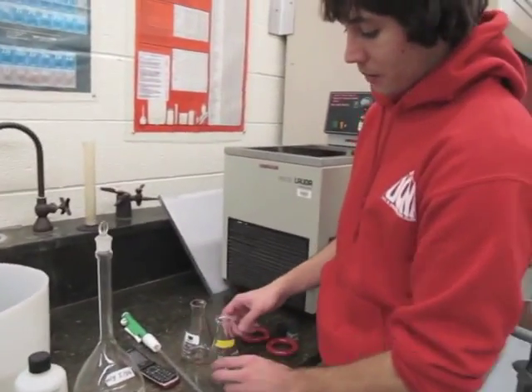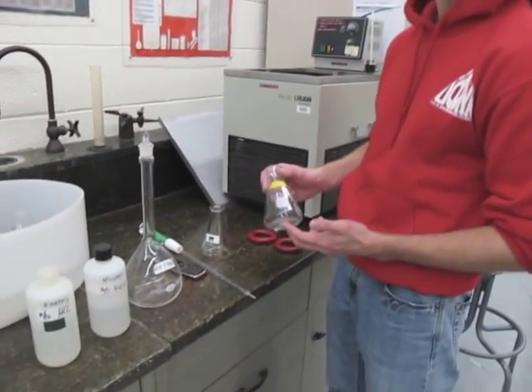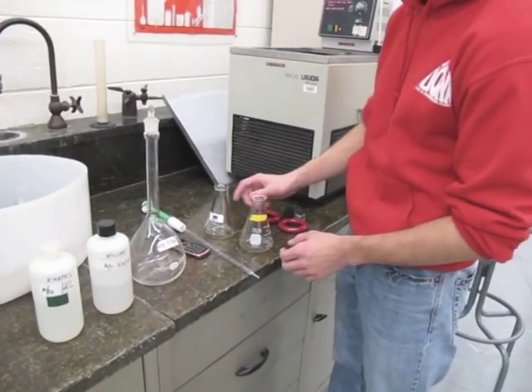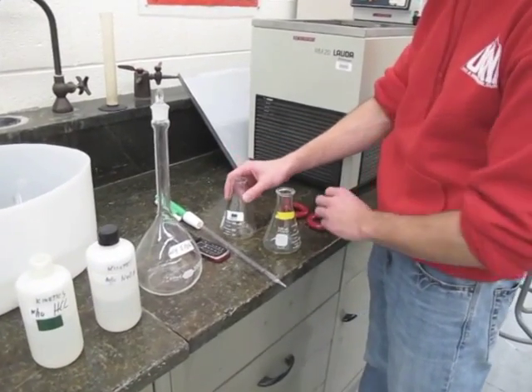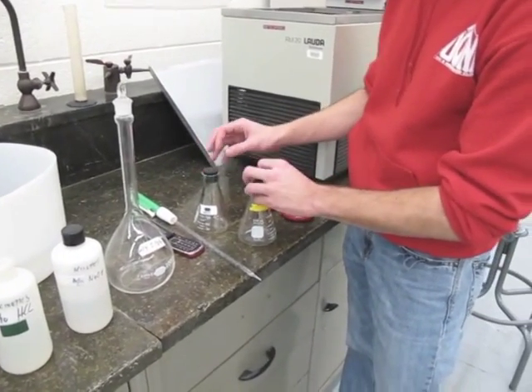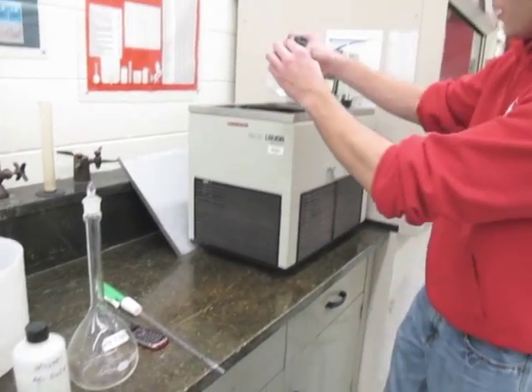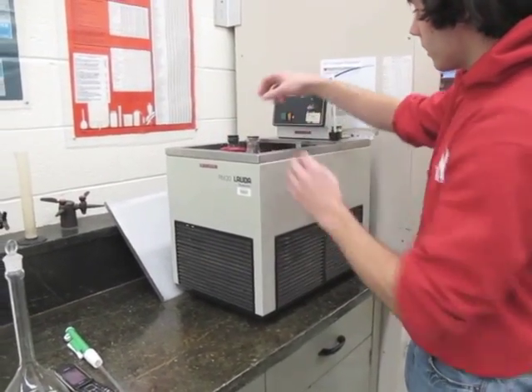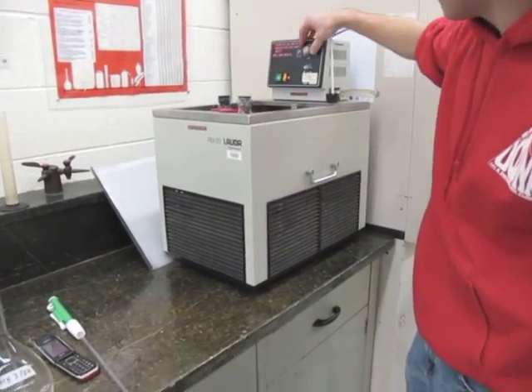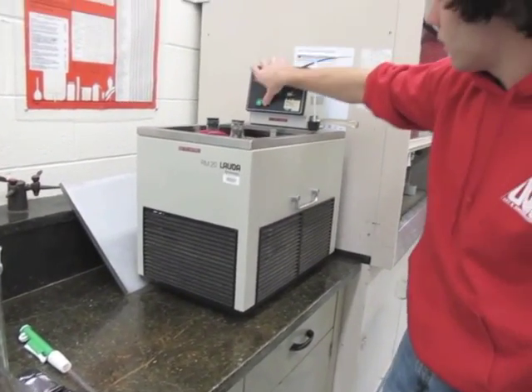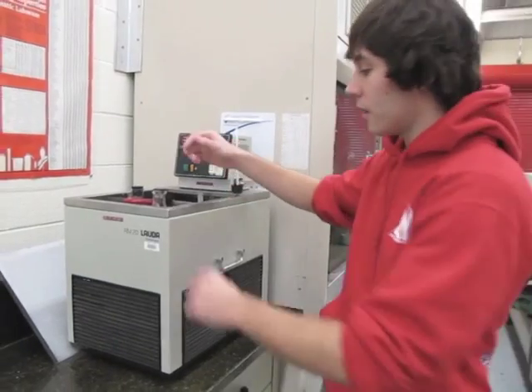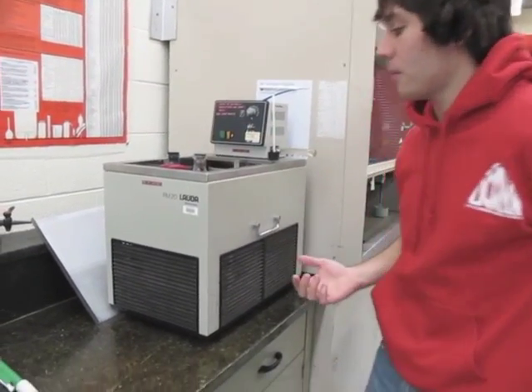To begin the experiment, you're going to add 100 milliliters of isopropyl acetate to this flask, 100 milliliters of sodium hydroxide to another flask. You're going to stopper them, put flask weights on them, put them into the water bath. You're going to turn on the water bath, set it to the first temperature, and let it equilibrate for 15 minutes.